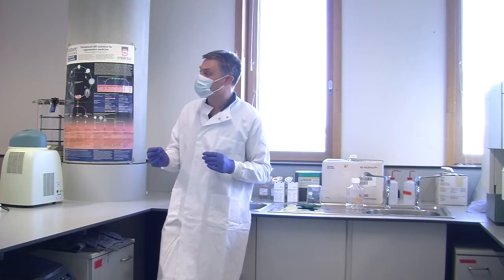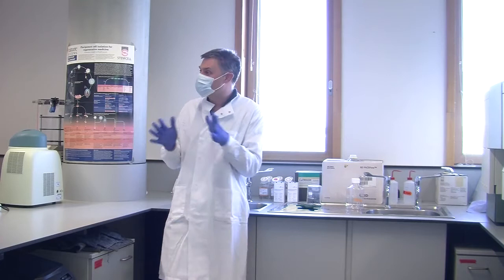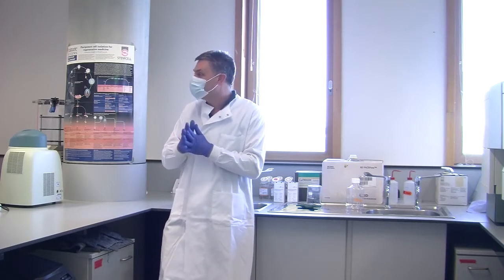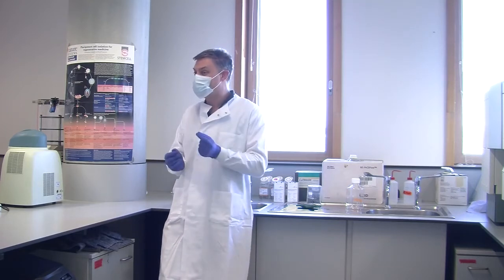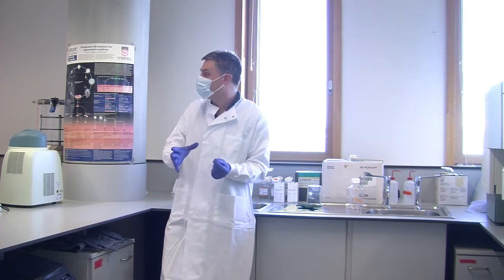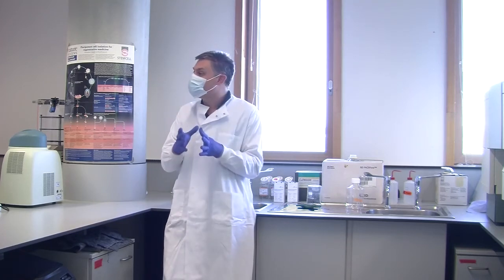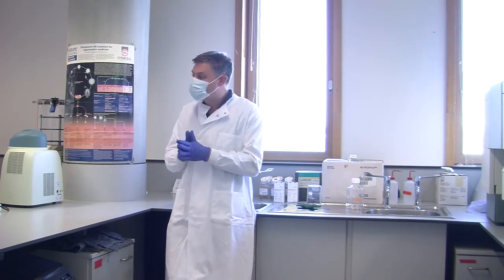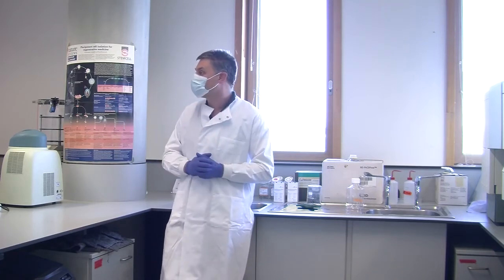And the more modern instruments that can do more colours, they say everything's automated, which is brilliant as a sales technique. And I've been a salesperson for a year or so. It's a great sales technique. Everything's automated. You rock up with your really complex sample, put it on, analyse. Great. But understanding what it is and how it works is really, really important, because without that, how do you know your data is real? How do you know it's correct? And therein are some of the problems.